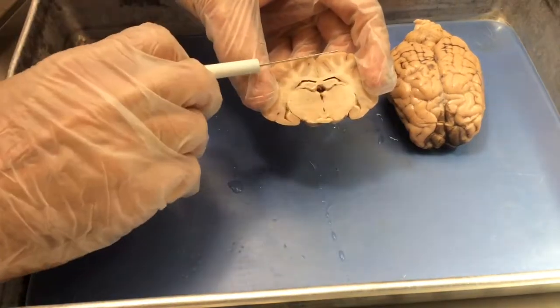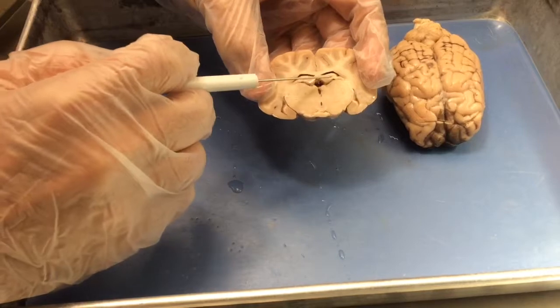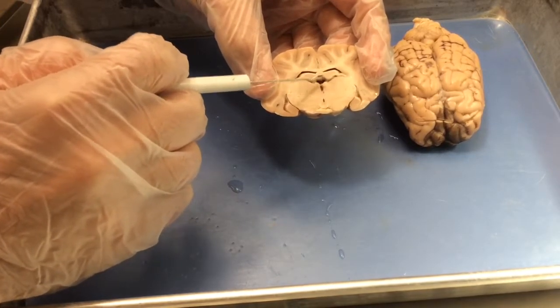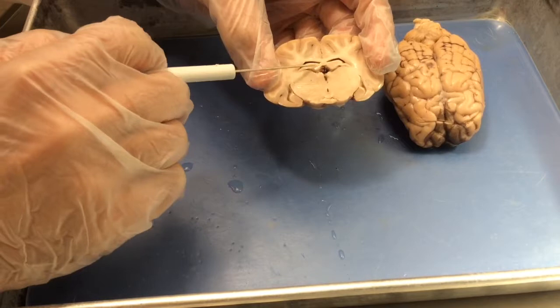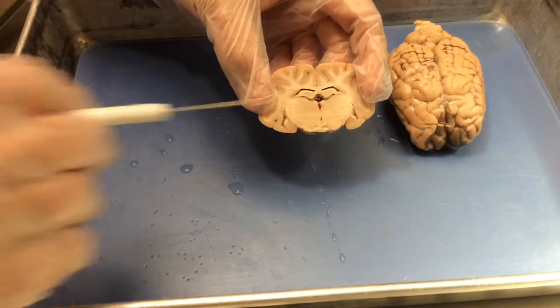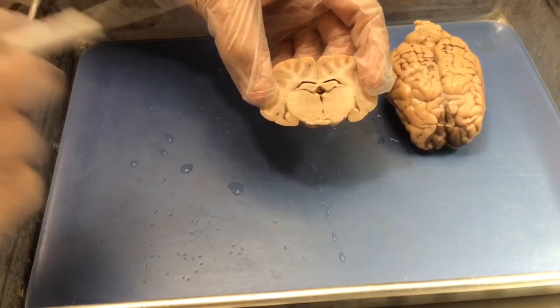Okay, so cortex, corpus callosum, lateral ventricles. Here's some choroid plexus here that's very visible, but that's in a separate ventricle that I'll talk about in a second. This plane of section seems to have almost what look like sunglasses right in the more dorsal part of the section underneath the lateral ventricles, and that's the hippocampus.